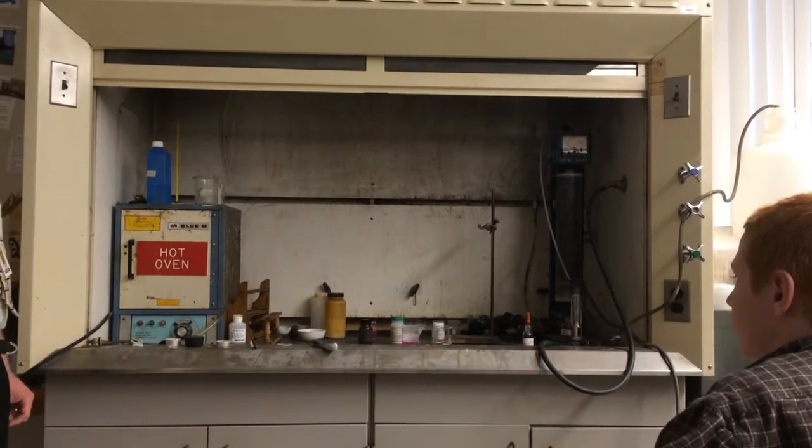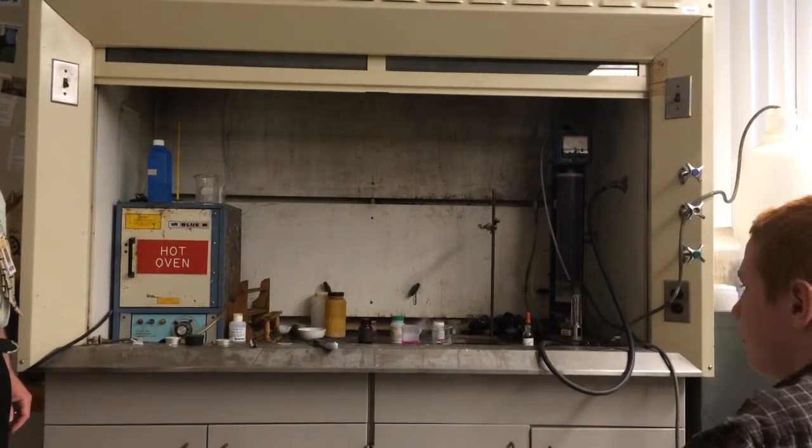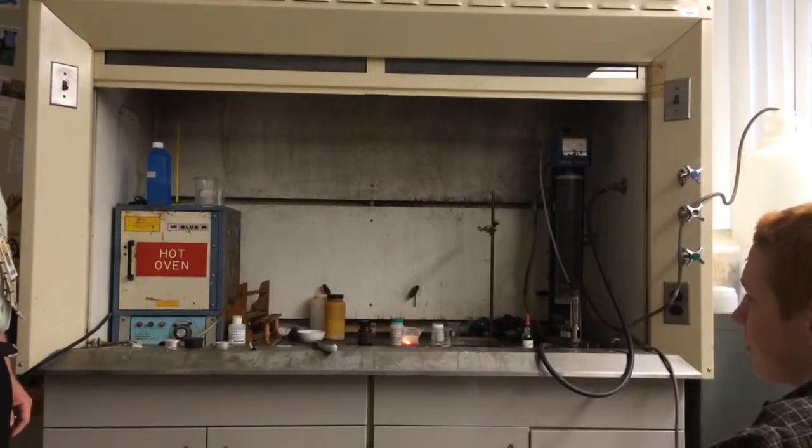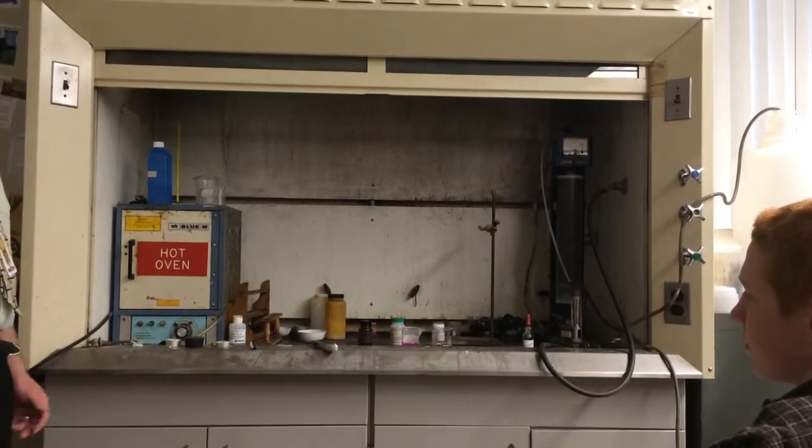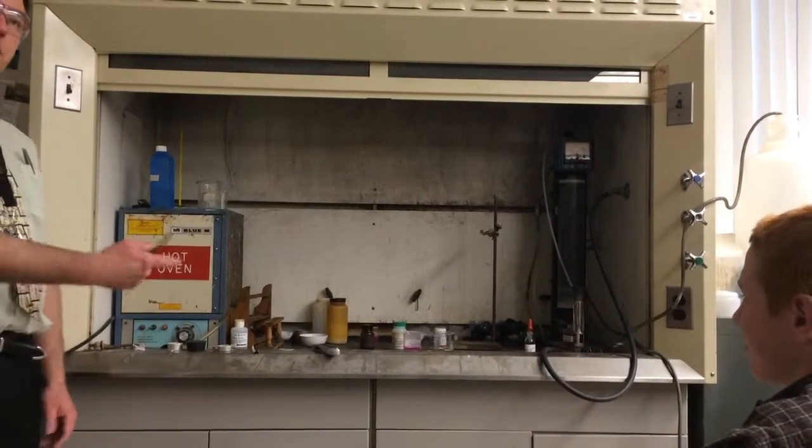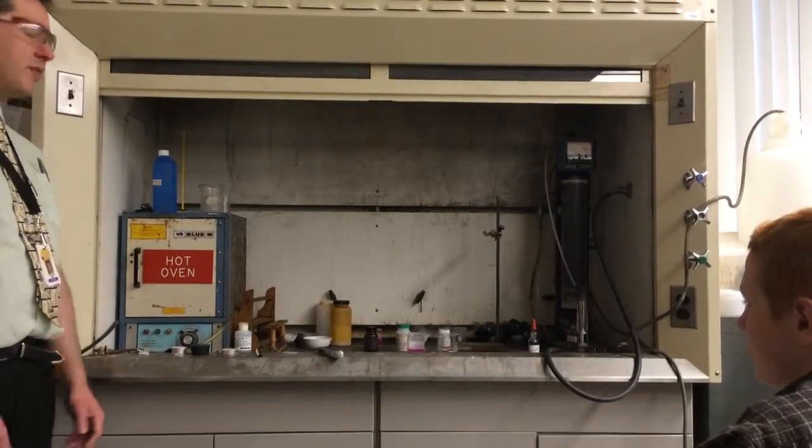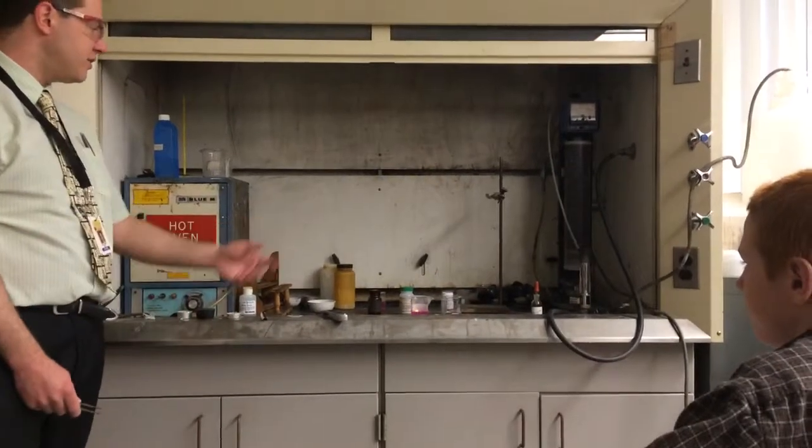Careful. Cover your eyes. You just may want to cover your eyes. So this one's a little more violent of a reaction, right? It's more reactive than the lithium was.